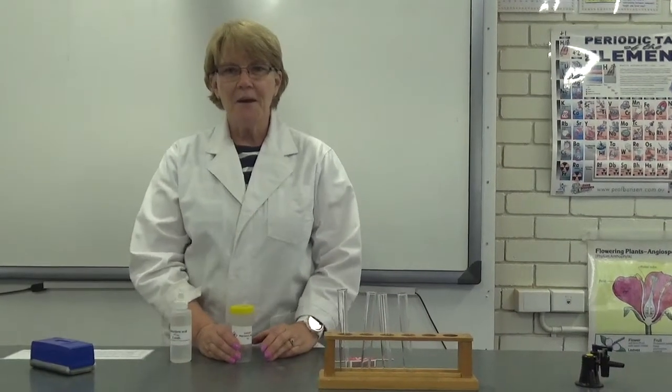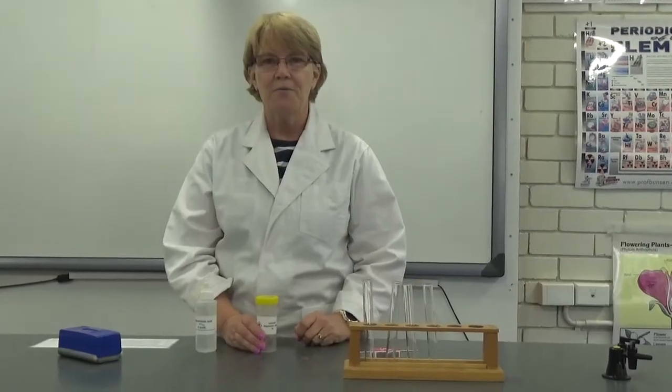Hi, it's Mrs. V again, coming to you from the Science Lab, and we are going to do another chemical reaction today.